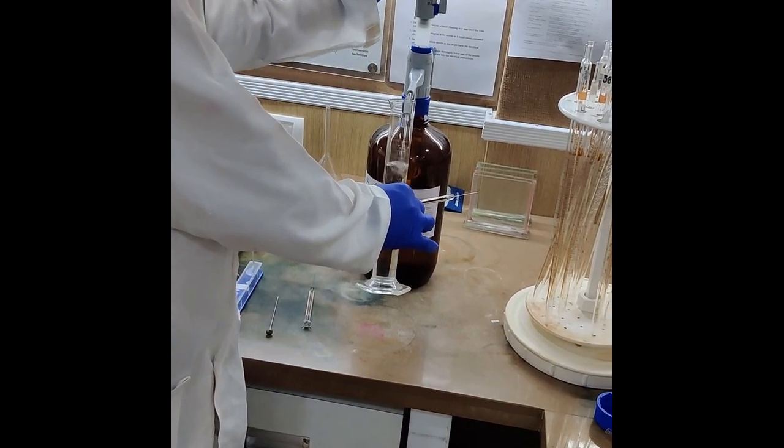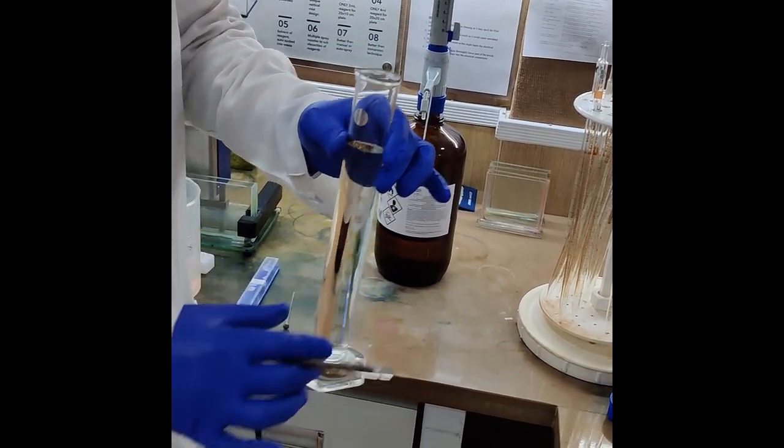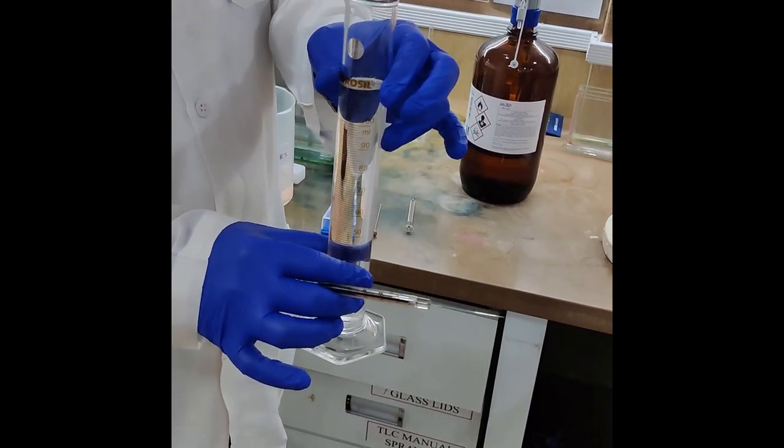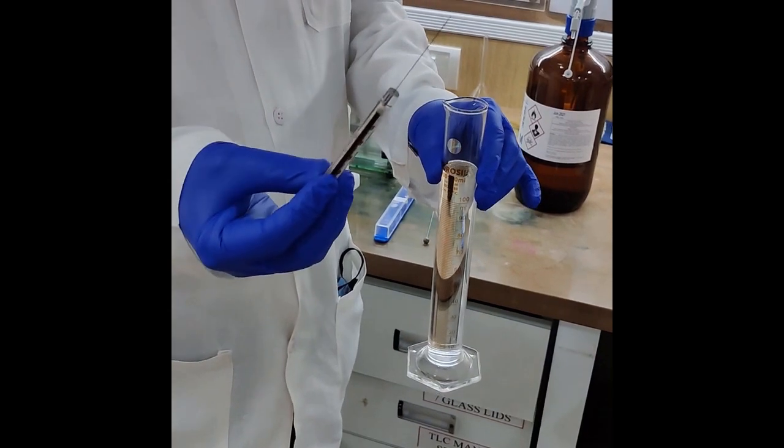Fill it till the top with little excess quantity, and now with the help of another syringe which is in working condition, carefully fill the syringe with the rinsing solvent.